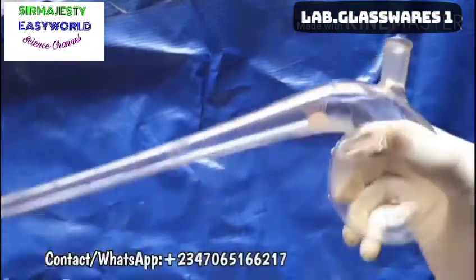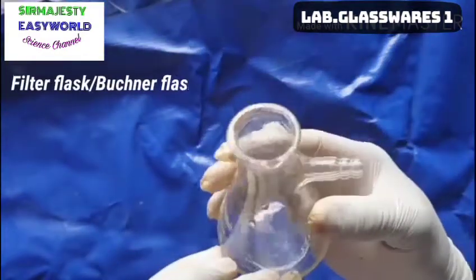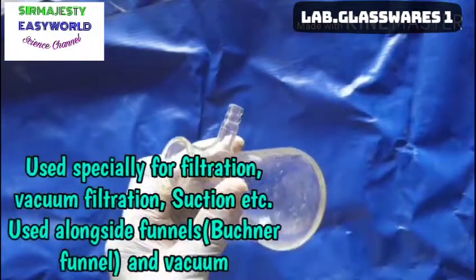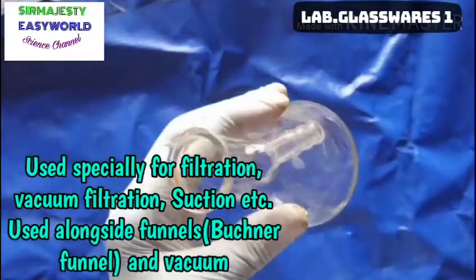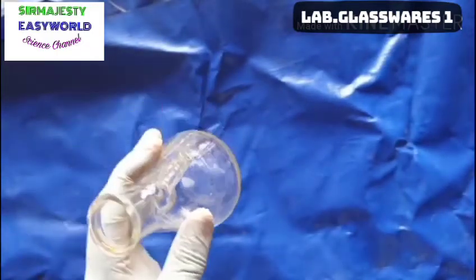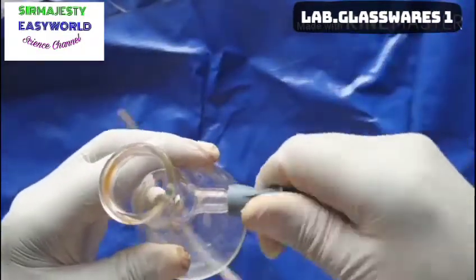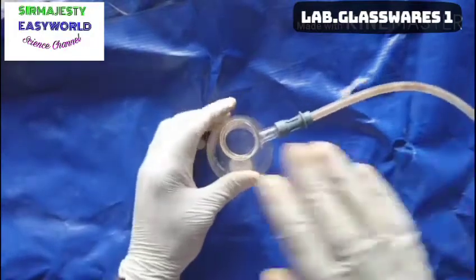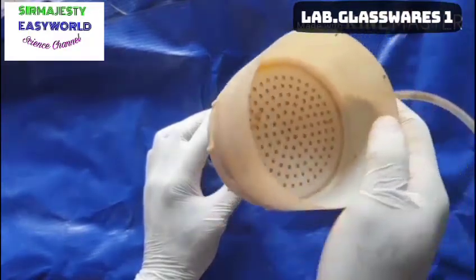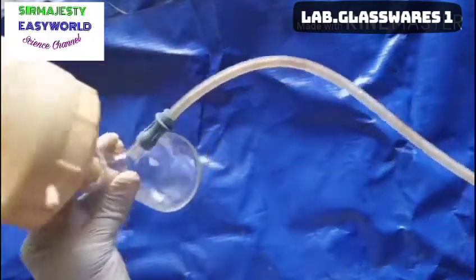Another flask is the filter flask, otherwise known as the Buchner flask or vacuum flask. This side arm is used to apply suction — when you apply suction pressure it removes most of the liquid. You connect a tube here, which is connected to suction. The Buchner funnel is placed here for vacuum filtration. You place whatever you're going to filter here, and connect it to a vacuum pump, which makes filtration very fast.